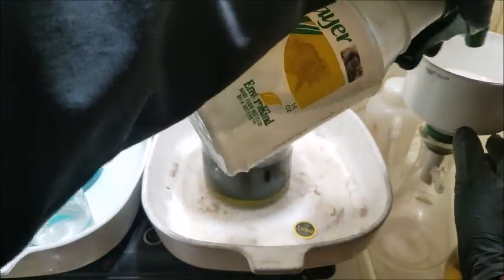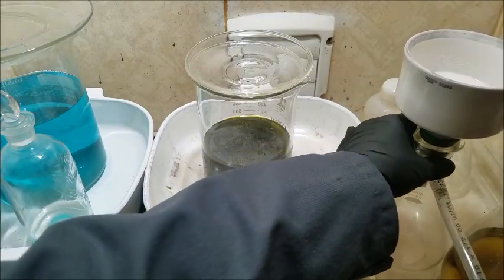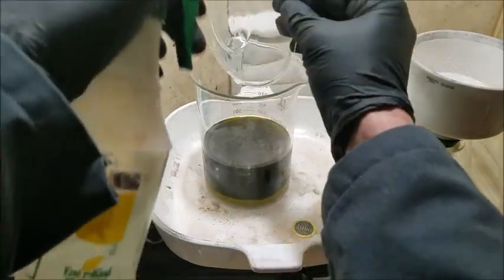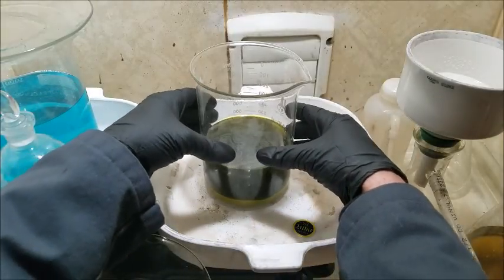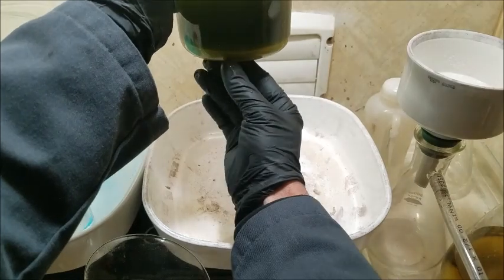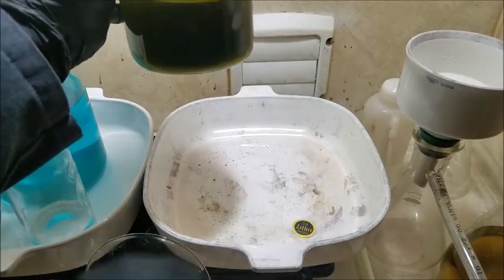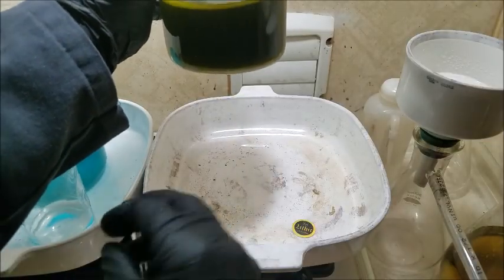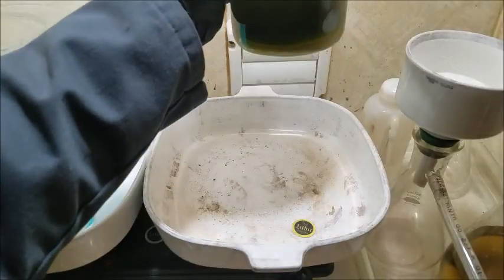I have a fresh Buchner funnel set up here. Take a look at this, you see we definitely had some sediment settle. Now, darn, I take it out of the light, it's harder to see. But it's a good layer down here. I'm not certain if that is some sort of silver chloride or if it's the pulp from all the filters that we had running through there, but we'll find out at the end. I'm gonna turn the vacuum on and start putting this through.